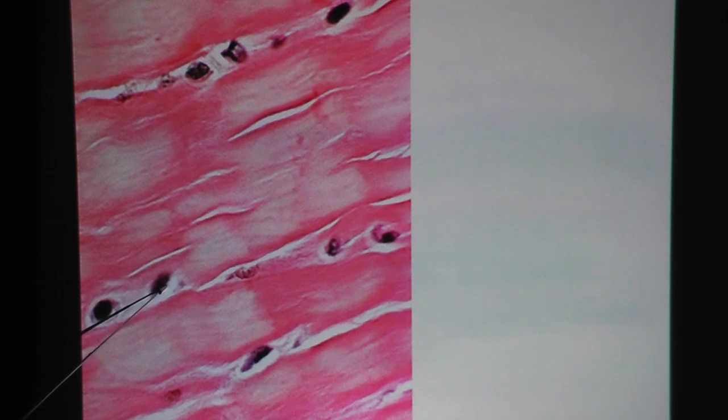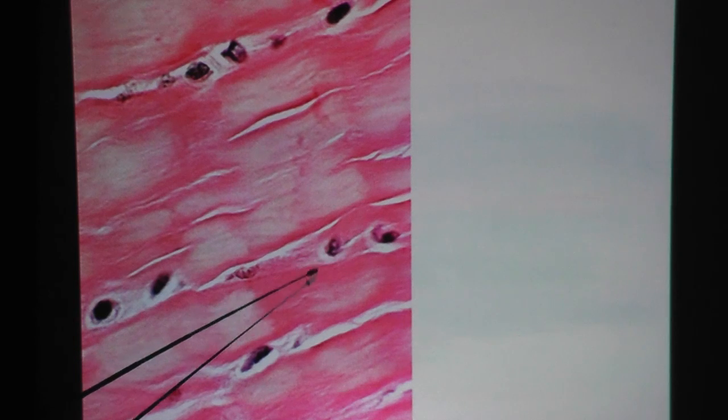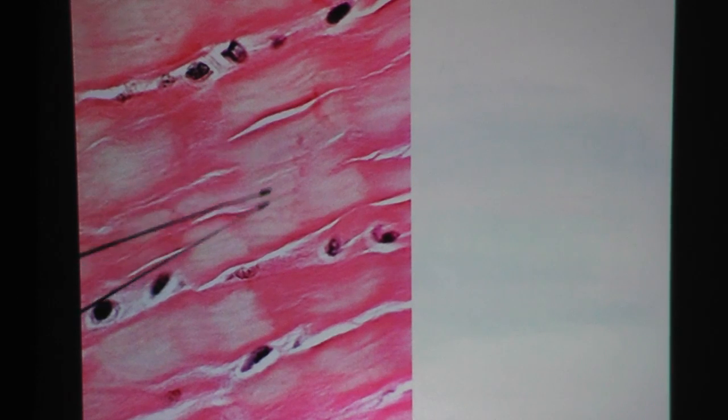This is high power. In high power, you can see the chondrocyte here in the white space called lacuna. Here's another chondrocyte in the lacuna. In between these lacunas, you see the matrix in a waviness type of pattern — that would be collagen fiber. This stain is very similar to the pink collagen fiber seen in the areolar loose connective tissue.